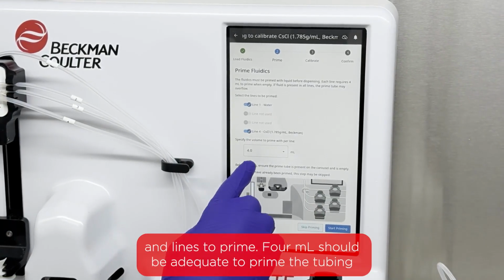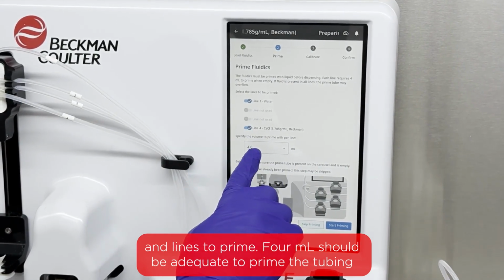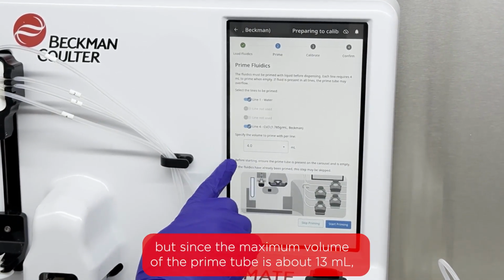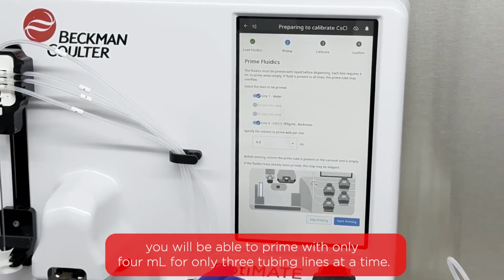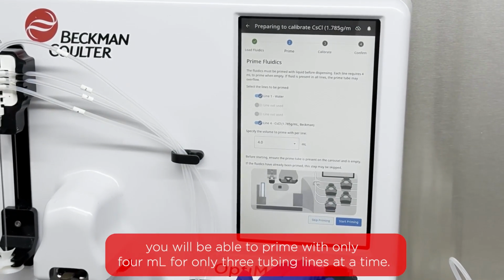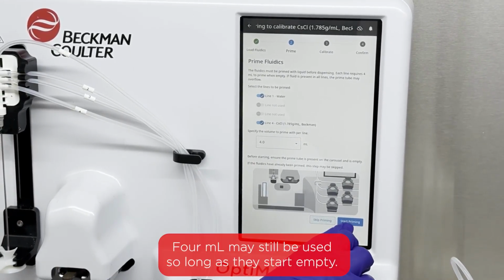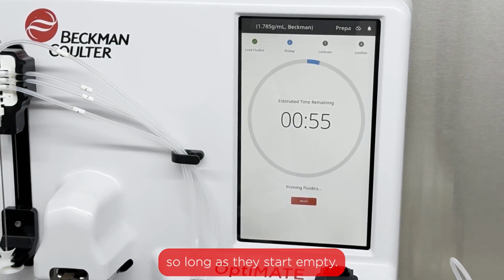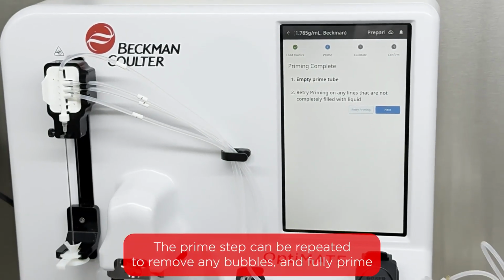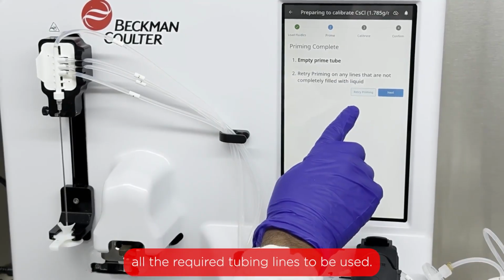Specify the volume and lines to prime. 4 mL should be adequate to prime the tubing, but since the maximum volume of the prime tube is about 13 mL, you will be able to prime with 4 mL for only 3 tubing lines at a time. 4 mL may still be used across all 4 tubing lines so long as they start empty. The prime step can be repeated to remove any bubbles and fully prime all the required tubing lines to be used.